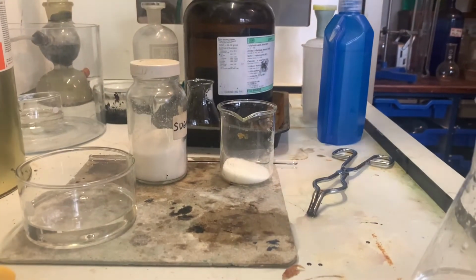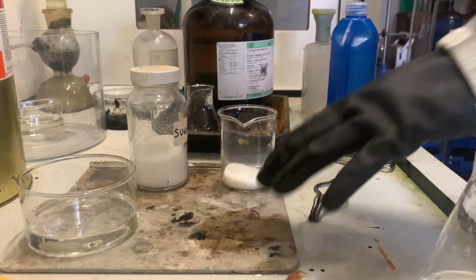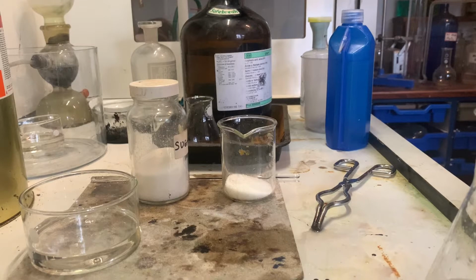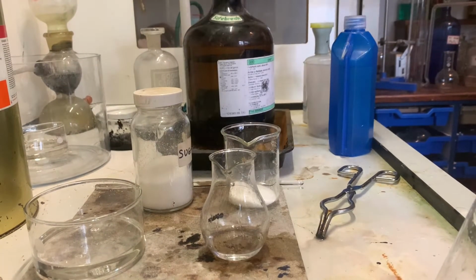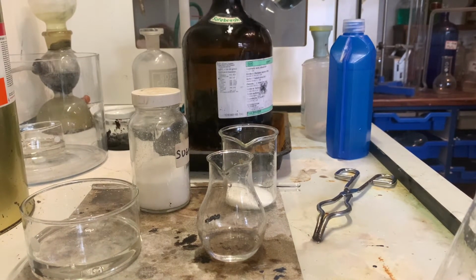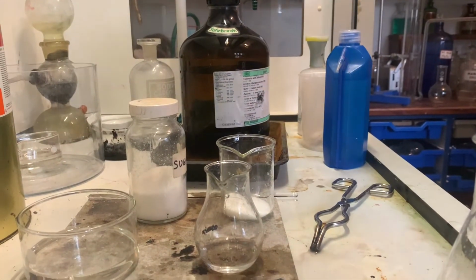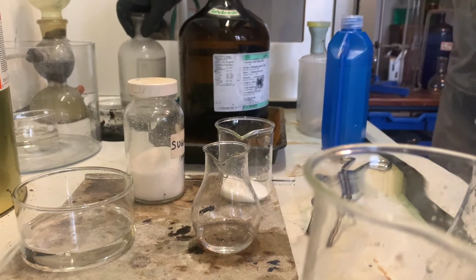As you can see, I'm handling sulfuric acid on asbestos mats, or heatproof mats, or not asbestos nowadays. And also it's very useful to put sulfuric acid if you're handling it on a tray, because no matter what, you'll always get a drip. And it's very useful that if you do get a drip, you can just wash down the outside of the bottle, and you can neutralize then anything left over using something like a sodium carbonate solution, which is very, very useful.